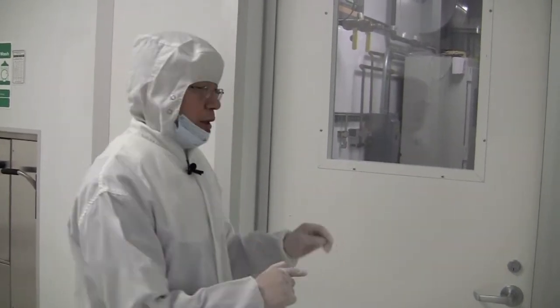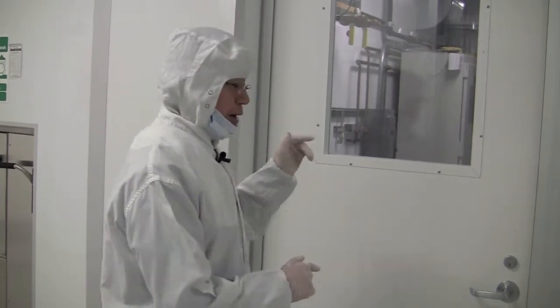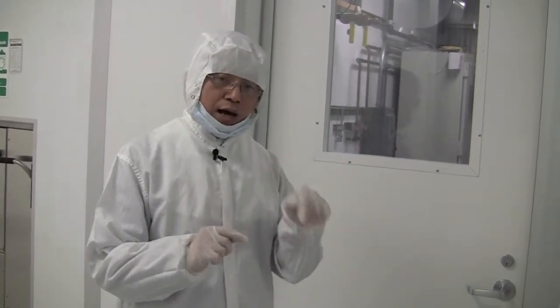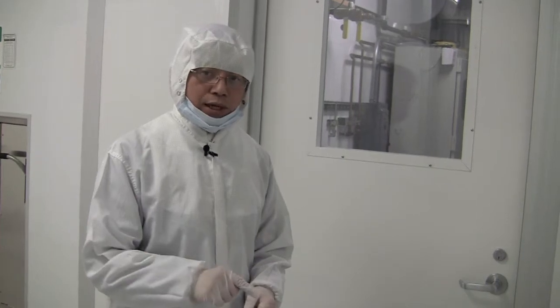So before we go inside, we should be very careful and we should smell and look first. If you see some suspicious liquid on the floor or smell strange odor, please don't go inside and immediately inform the lab manager or staff.